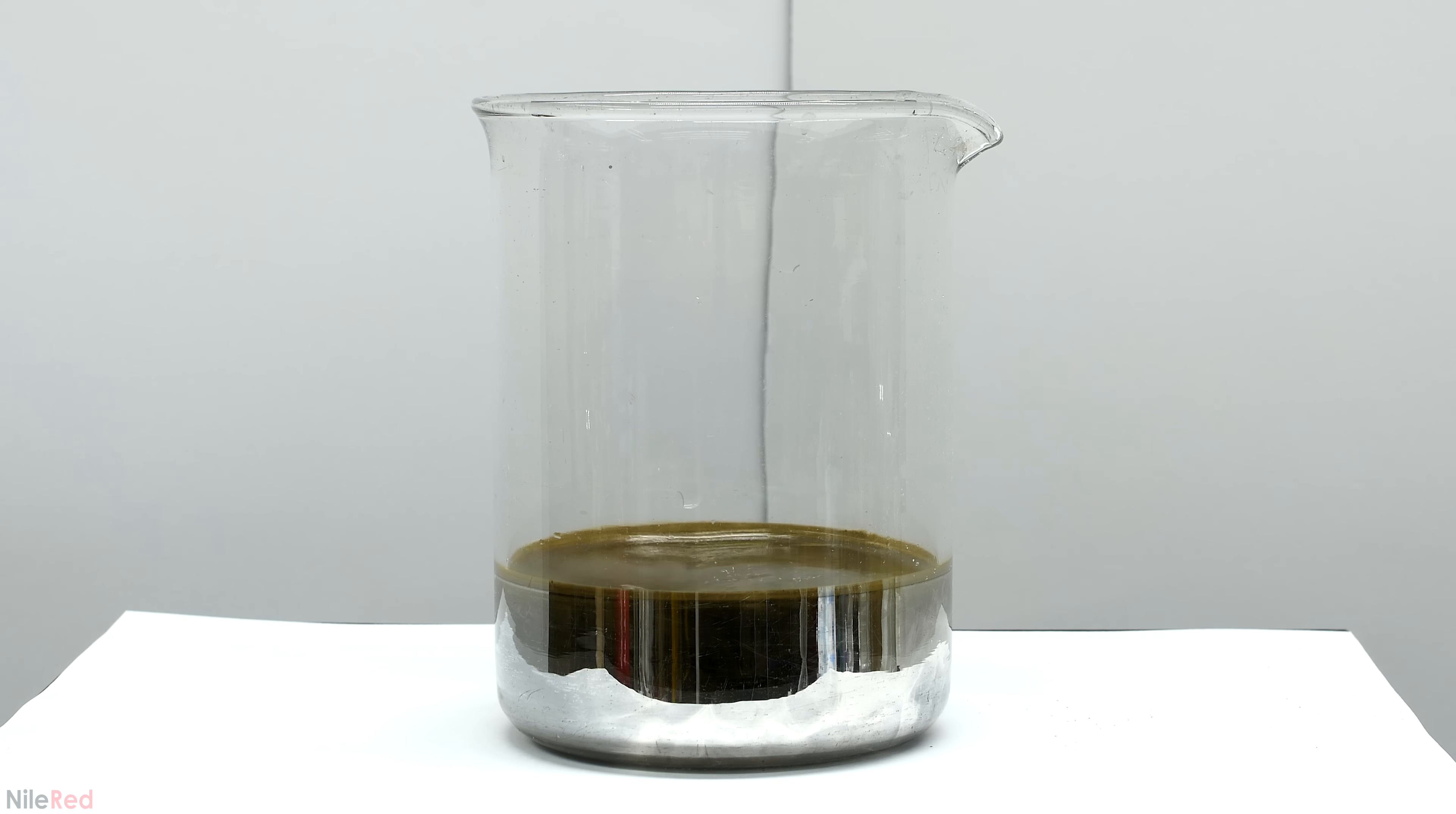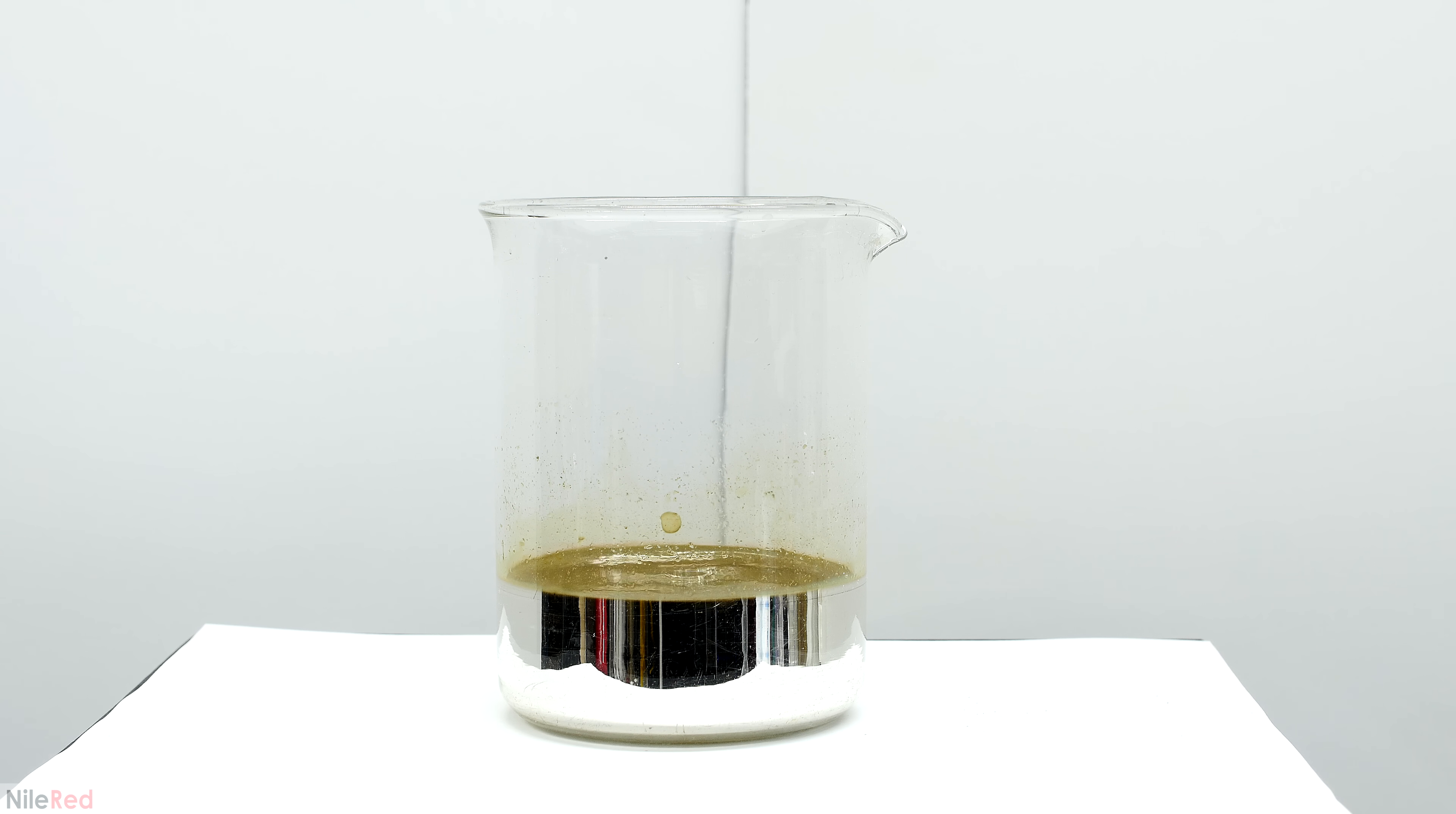What you're seeing here is sped up, and it took about three minutes in real time to fully form the mirror on the beaker. After the mirror had formed, I dumped out the contents and washed out the beaker and took a look inside.